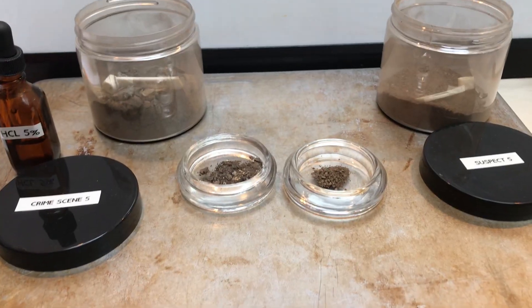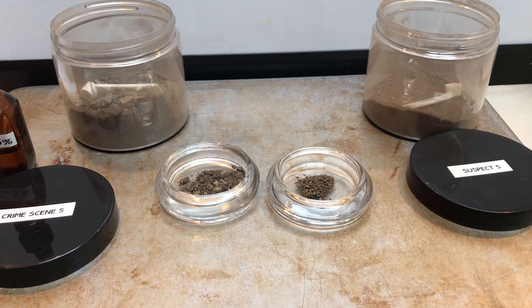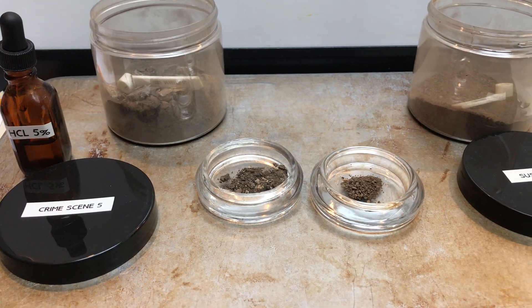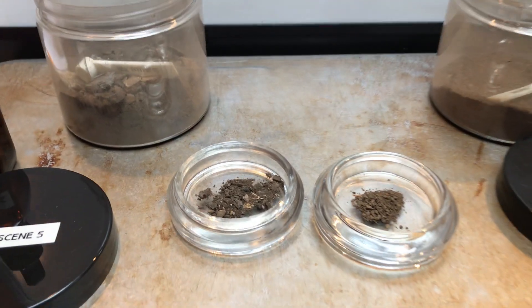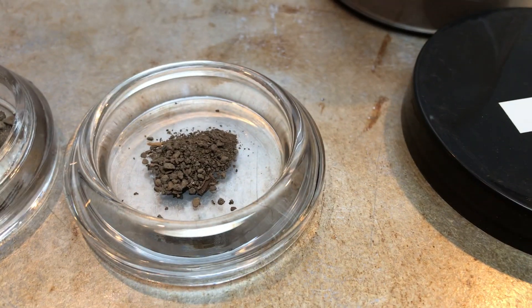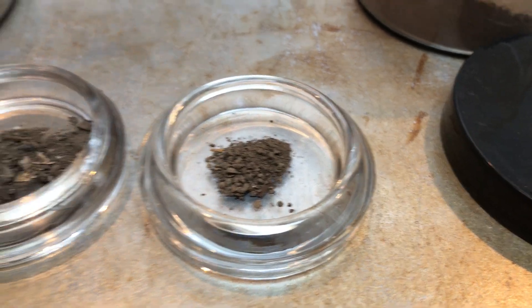Hey ladies and gents. Today we're going to be doing the acid mineral calcite test. We have our two soil samples — our crime scene sample on the left and our suspect sample on the right.